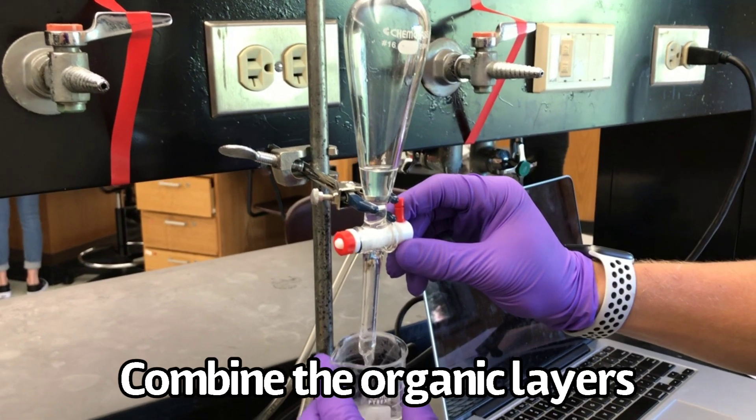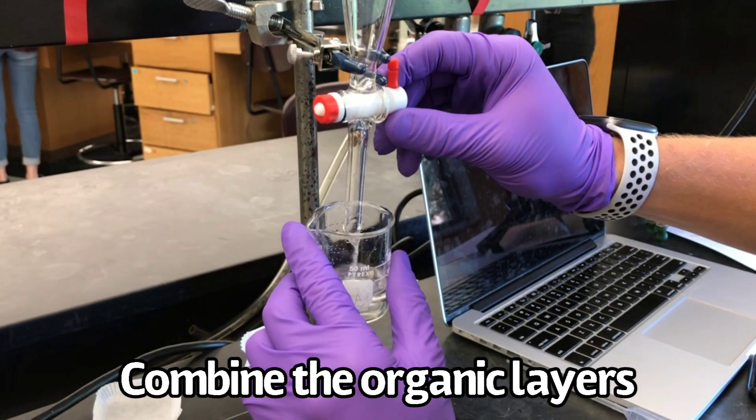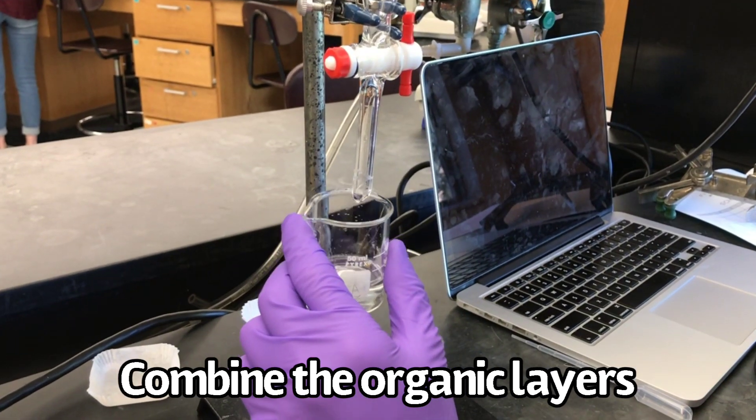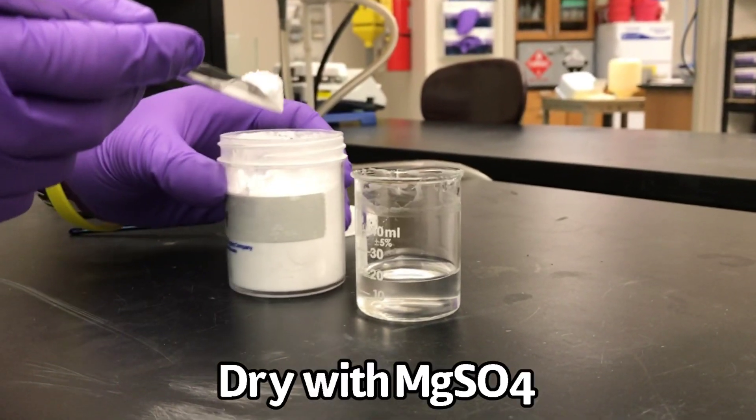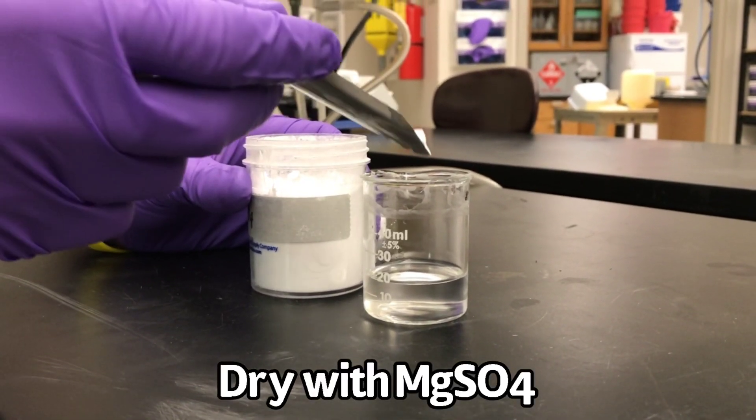Combine your top organic layer with your previous organic layers. Dry with magnesium sulfate.